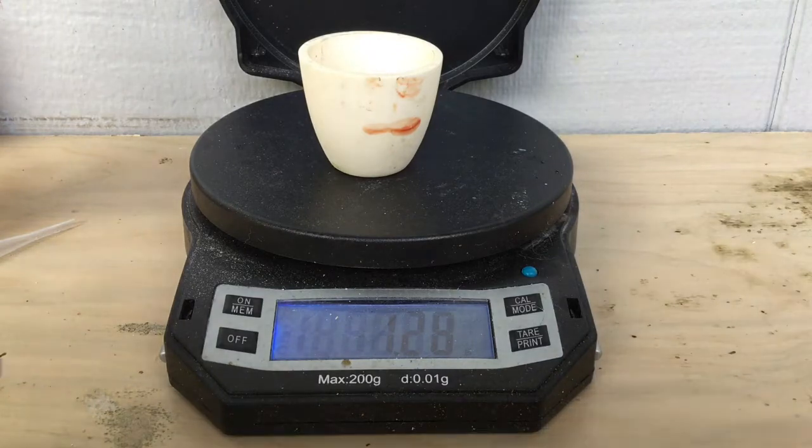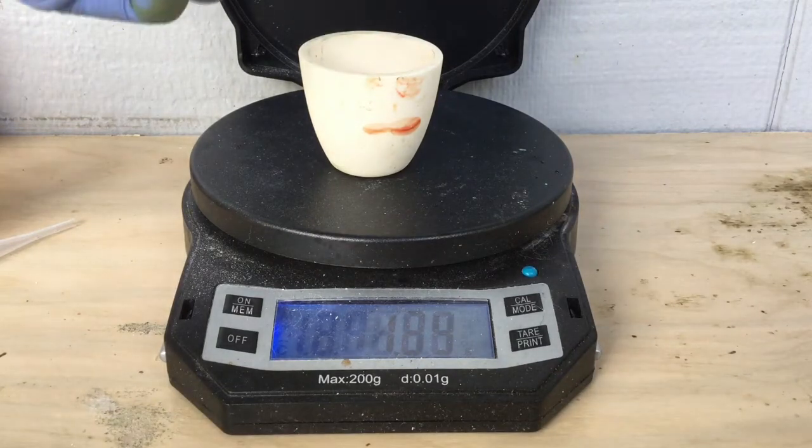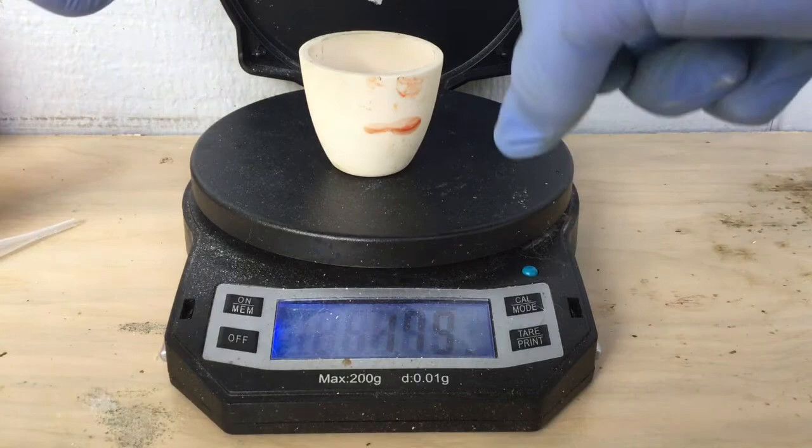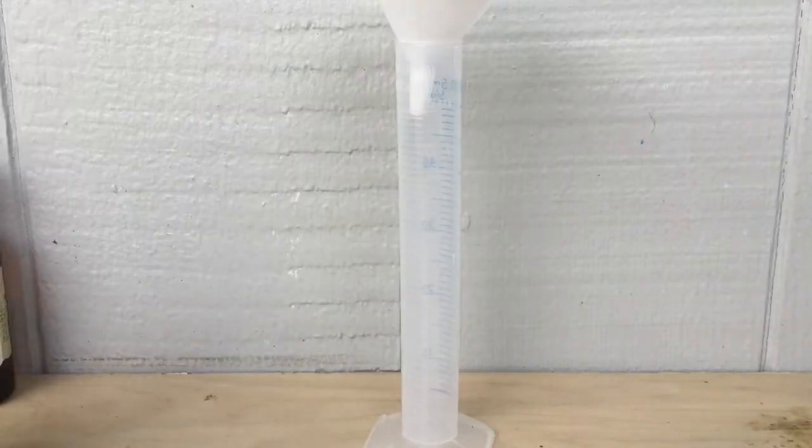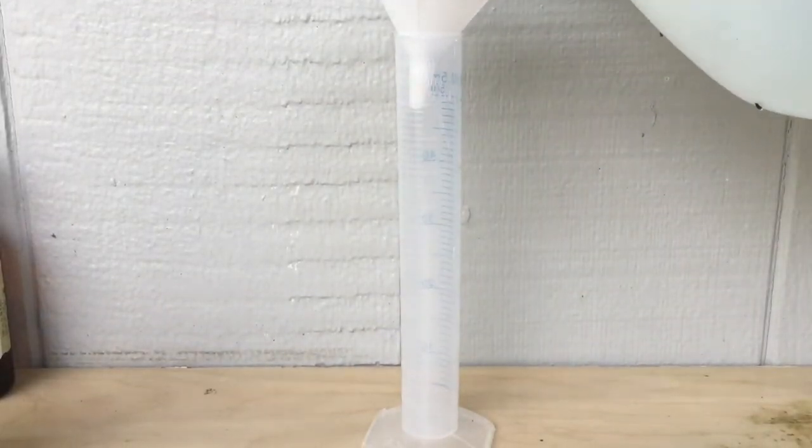So the first thing that we're going to do is weigh out some sodium hydroxide according to some calculations that I did. I'm going to measure out around 2.4 grams.